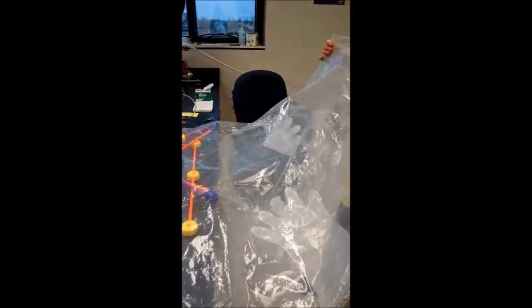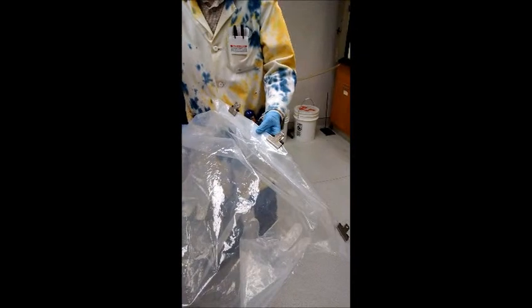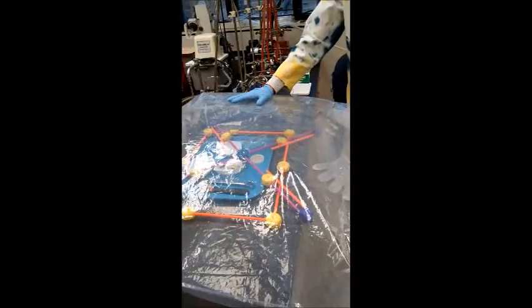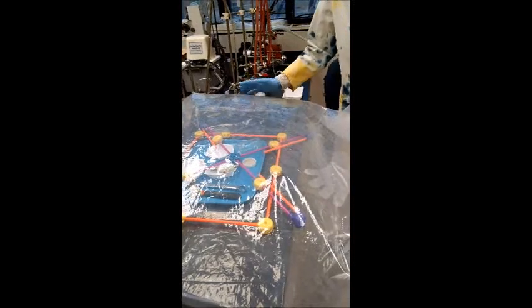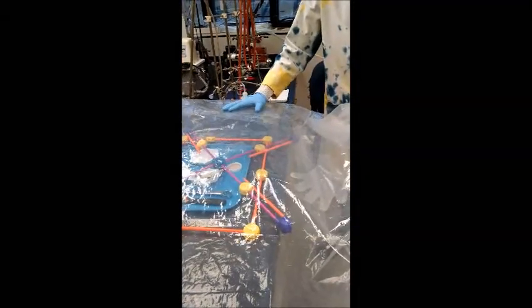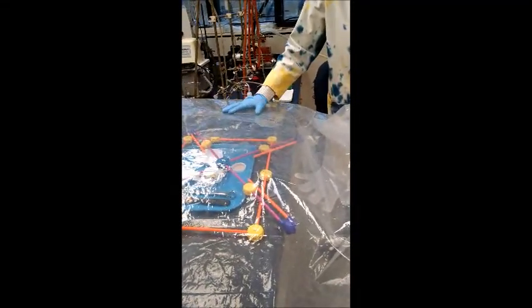To do the purging we're going to actually seal the bag. We have our glove bag filled with argon. We don't want it to fill to the point where it's bursting at the seams, and so we're ready to do the purge.